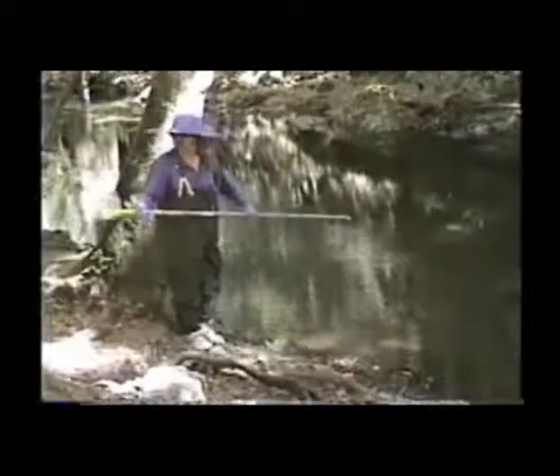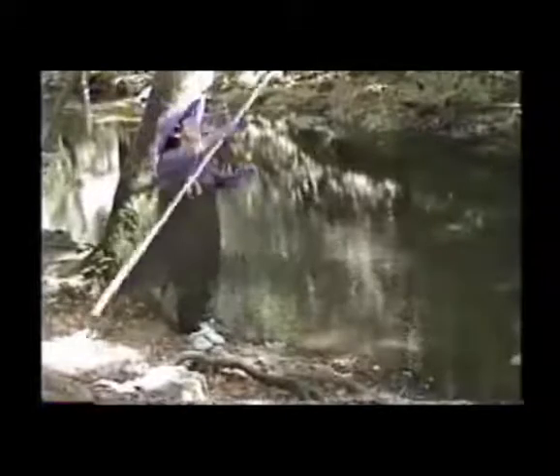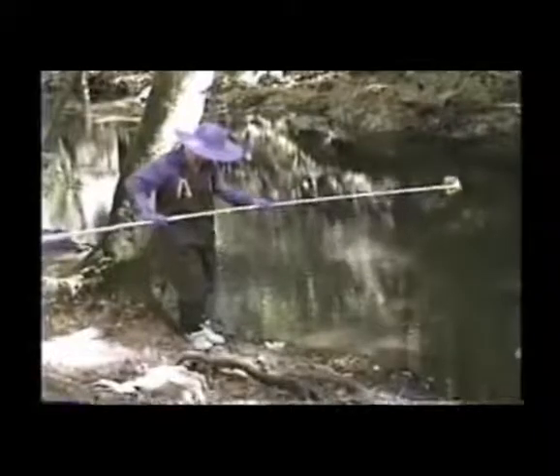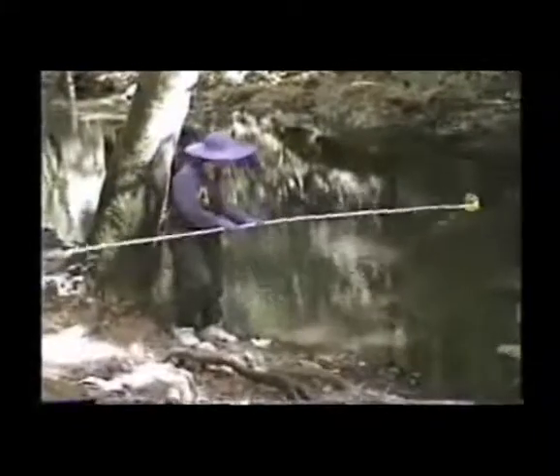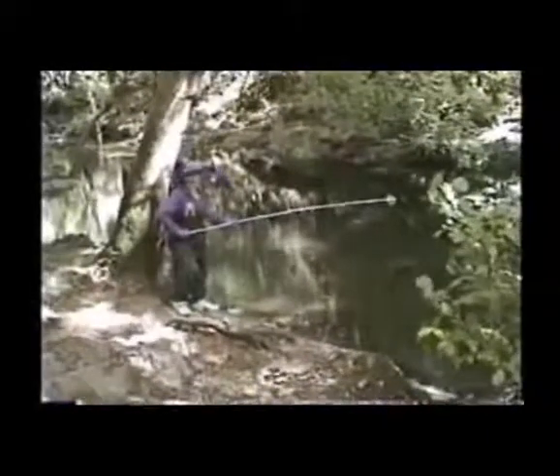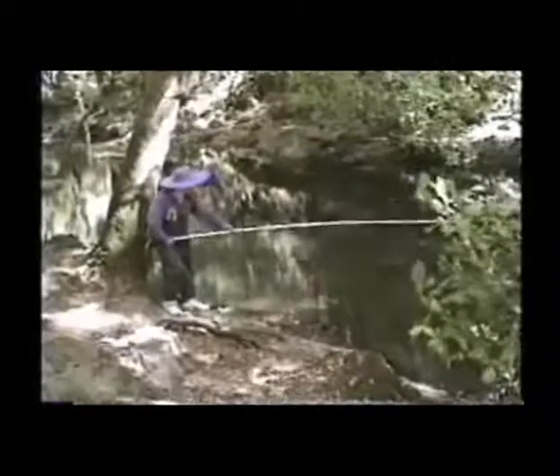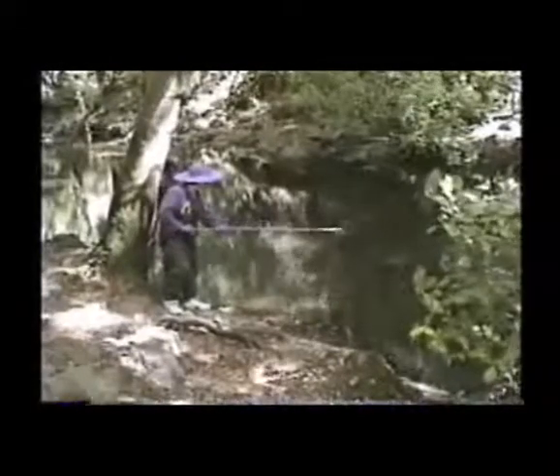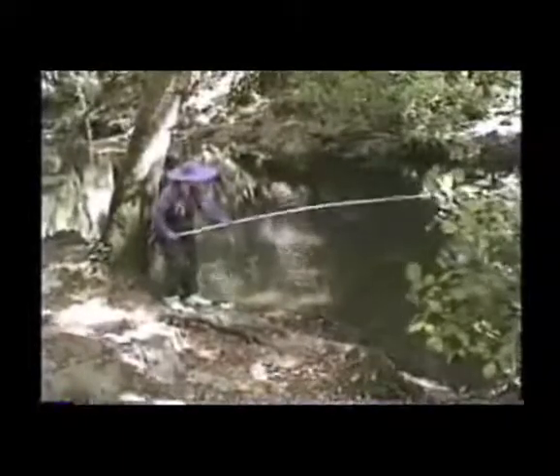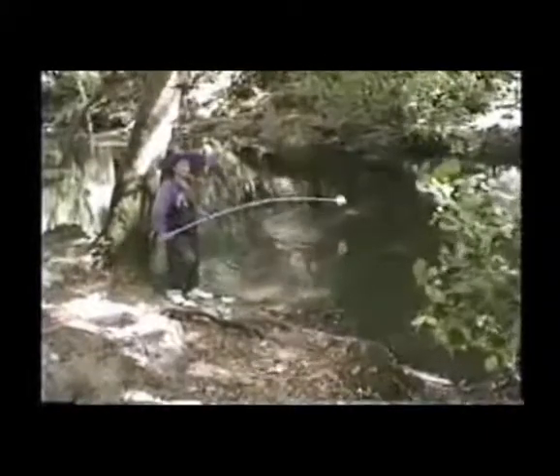Now, if you get a telescopic pole, you could actually extend your reach to about 12 feet, all the way into the center. And the way you use this is very simple. This way, now you can actually reach wherever you want. You can collect, wash your sampling device 3 times. Collecting the water under the surface, washing it 3 times downstream, and then bringing back the sample.